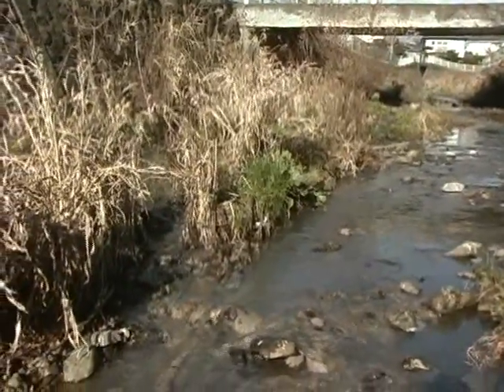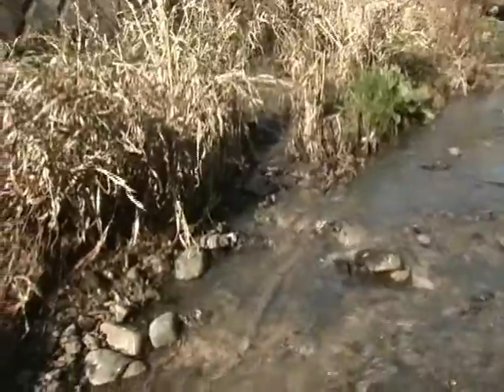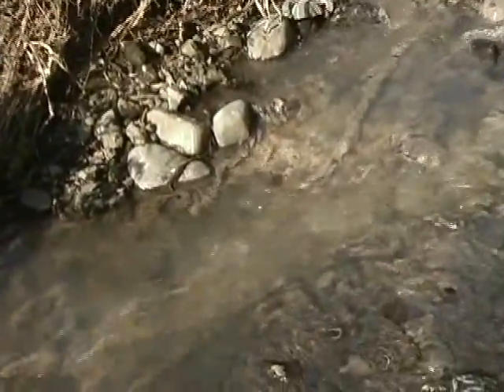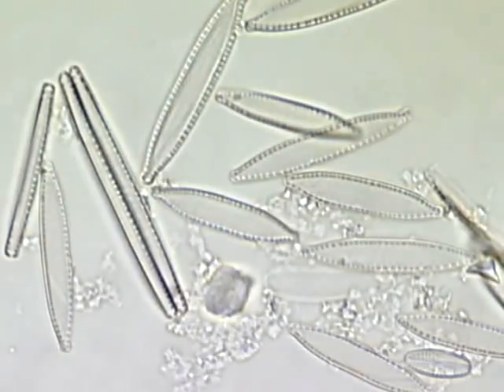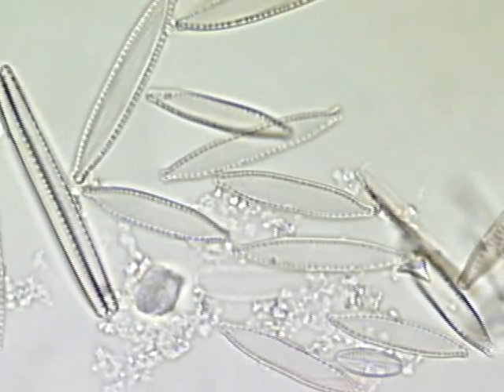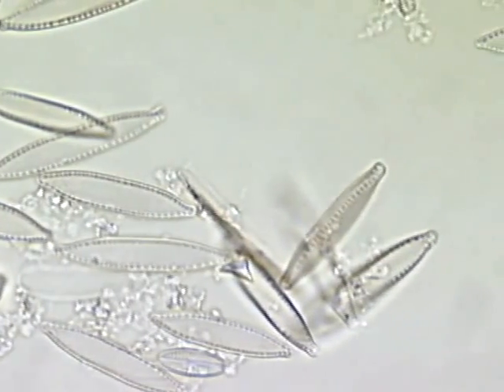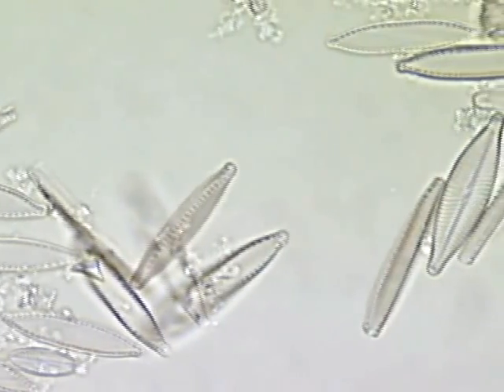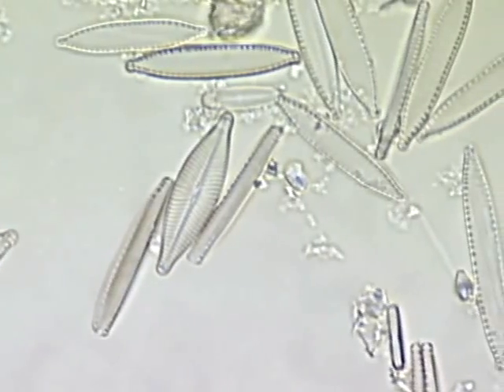Could there be diatoms in this type of water? Let's collect and clean a sample of this water and view it under a microscope. Yes, even in such severely polluted water, diatoms are able to exist. And now, let's see what kinds of diatoms inhabit clean water.